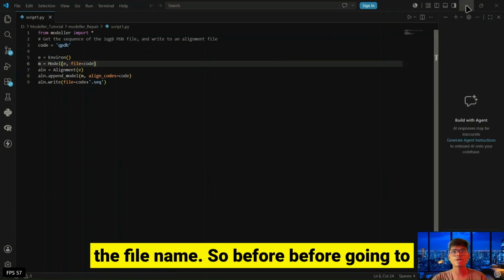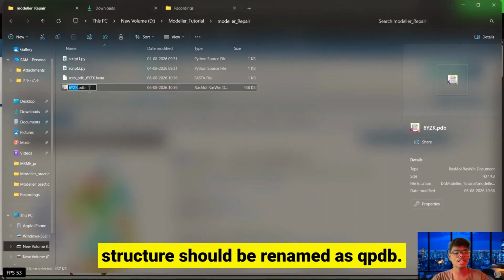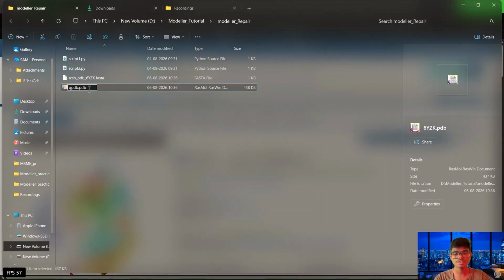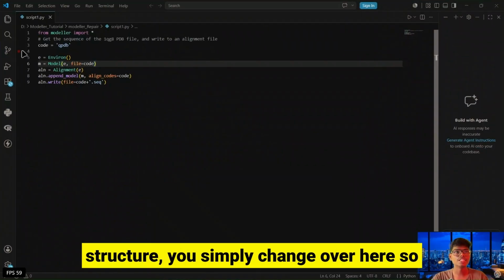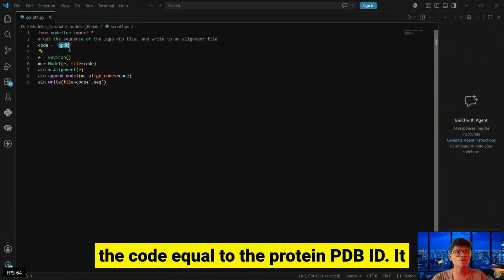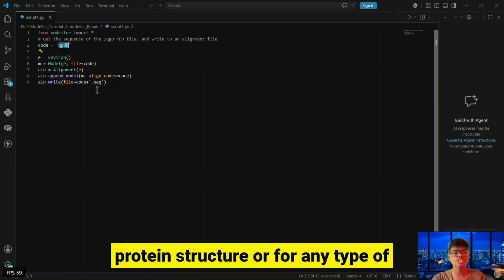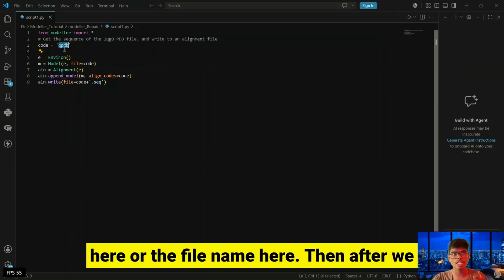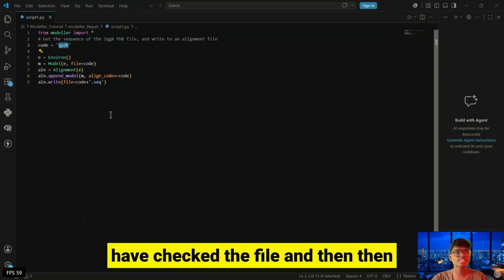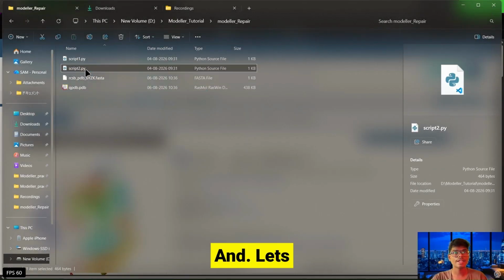Before going to that, let's click here, and the protein structure should be renamed as qpdb. If you don't want to rename this protein structure, you can simply change it over here. So the code is equal to the protein PDB ID, it will be up to you. For convenience, you can write your PDB ID here or the file name here. Then we have checked the file, and then let's move to script2.py and visualize.